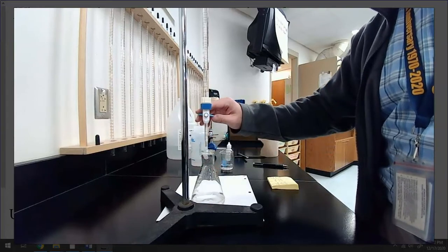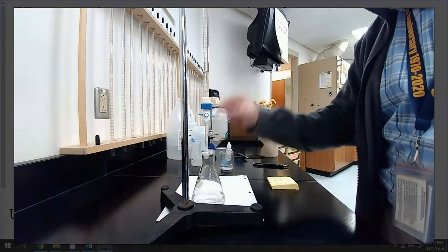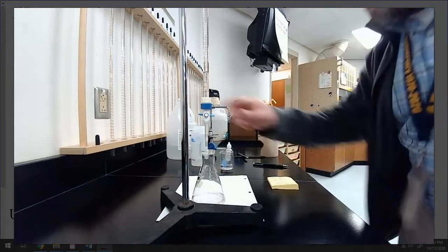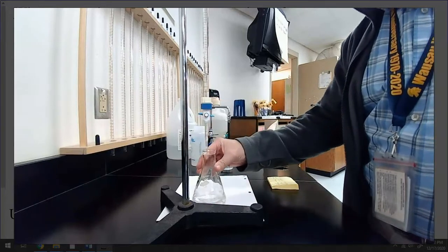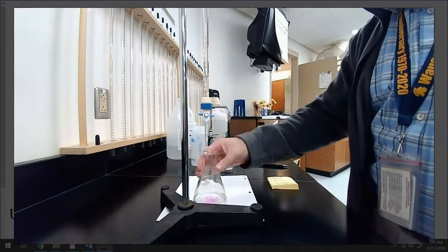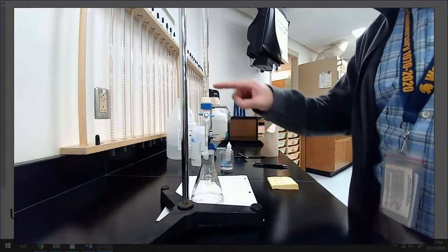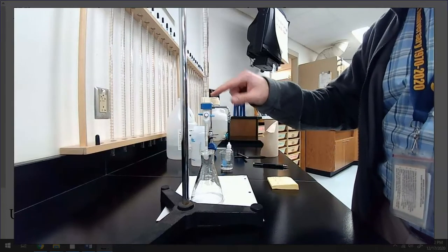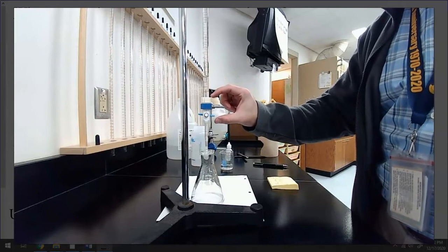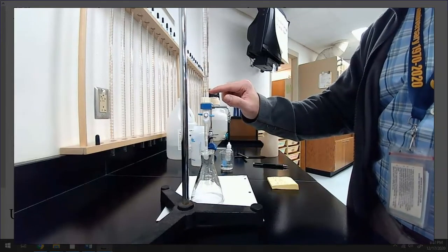I'm racing towards the edge of a cliff. See if I can salvage it before I go off the edge. I got about 5 milliliters left before I got to refill this thing. And I don't want to refill it mid-titration. That's a pain. You can do it, though. Nothing wrong with it. If it goes down, I don't want it to go below 50. There's the 50 mark right here. If it goes below that, I have no clue how much I've added. But if I keep it above 50, I could just record, right, where I stop.